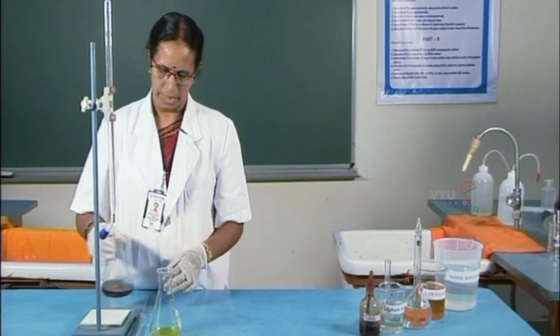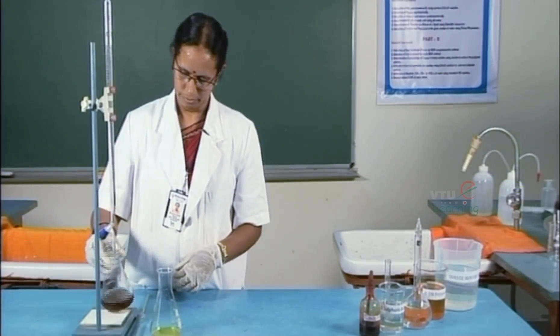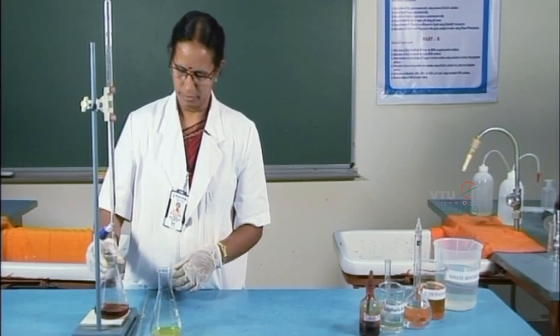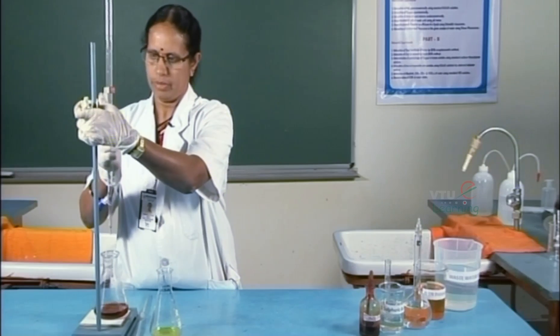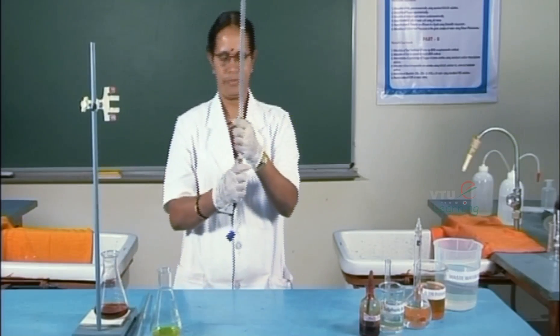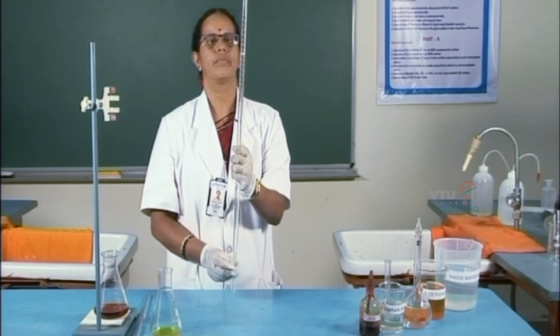This is the back titration, and the burette reading is 11.7.